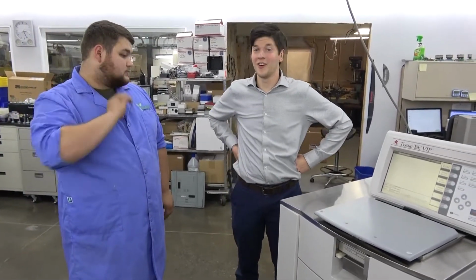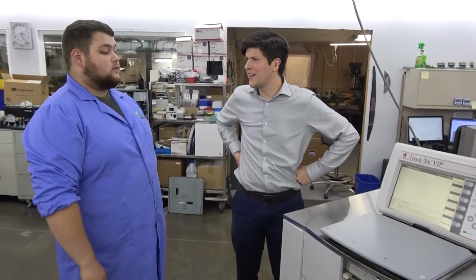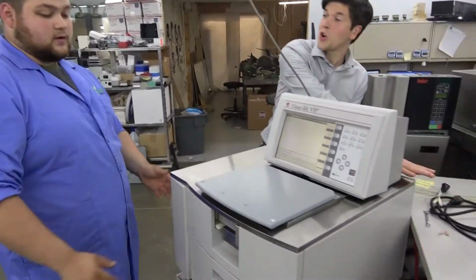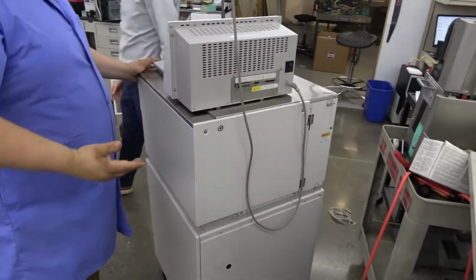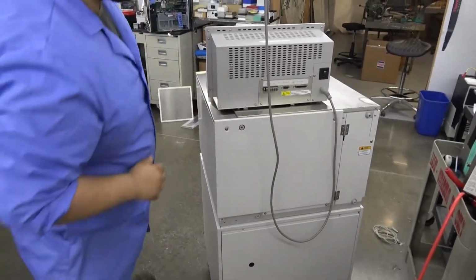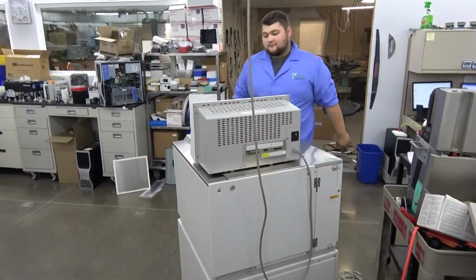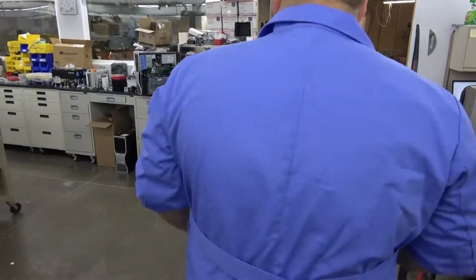They put an internal electrical conversion in this thing, right? Did you step it up to 220 or down to 110? Down to 110. So this is a 220 unit that has been converted. In this corner, it's got an internal conversion. We can show you if you'd like. Can you actually pull it out? Yeah, I can pull that off real quick for you. This is customized. If you'd like to see what Bart's up to, I can have these panels off and ready for you.